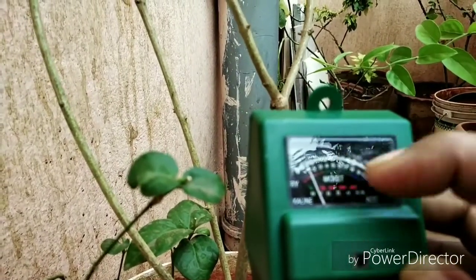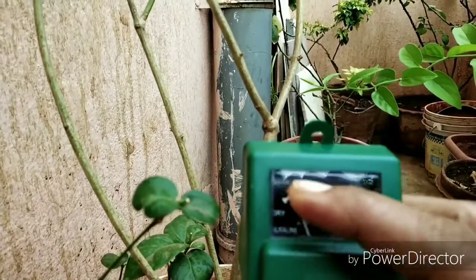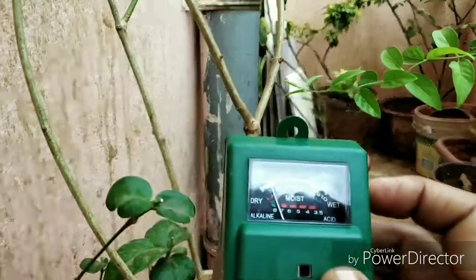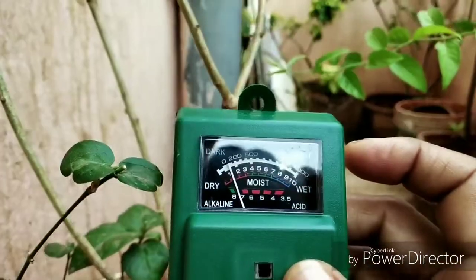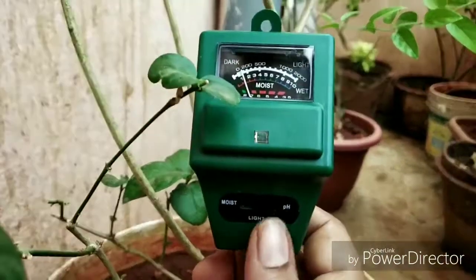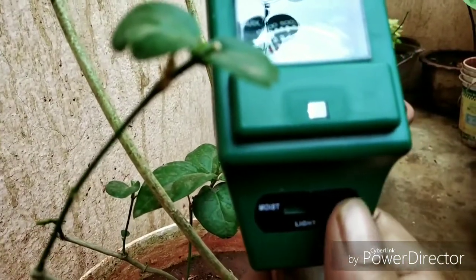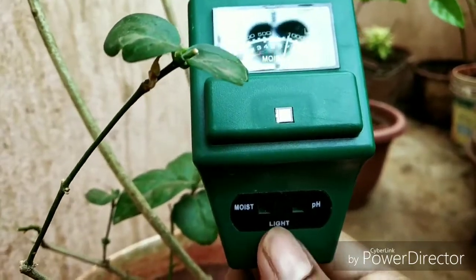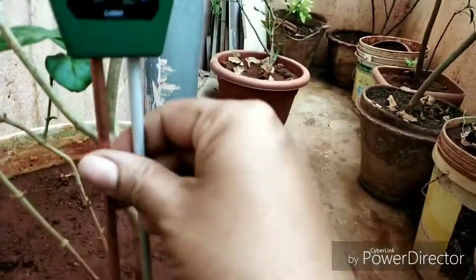This is the 3 functions. This is the lighting. This is the button. This is the 2 functions.